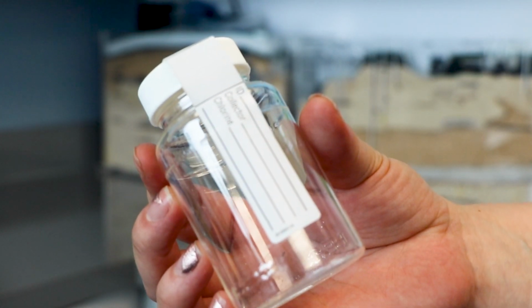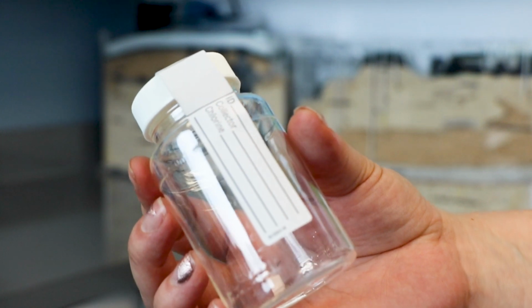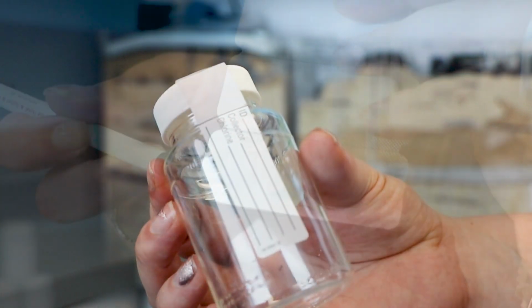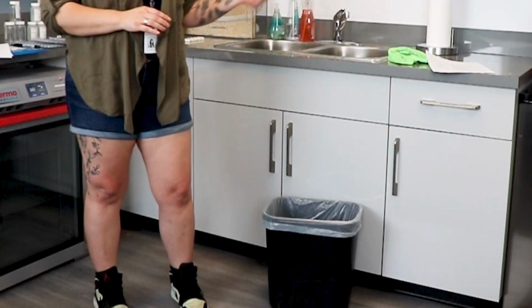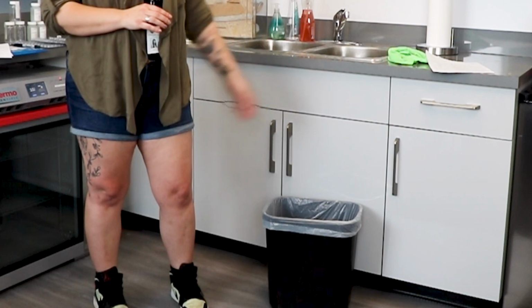In your ColiAlert lab, you must maintain an inventory of laboratory materials and equipment. Store sterile sample bottles in a dry location where they will be protected from contamination. Check the expiry date on the reagent packets before using them. Discard expired reagents. Results from expired reagents are not valid. Contact your environmental health officer or designated contact for new supplies.